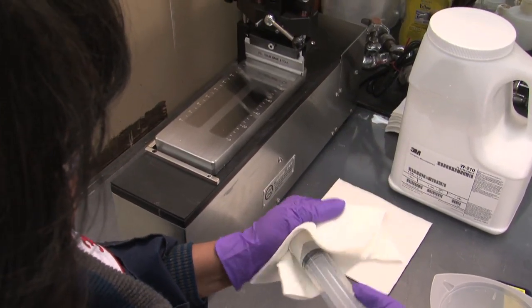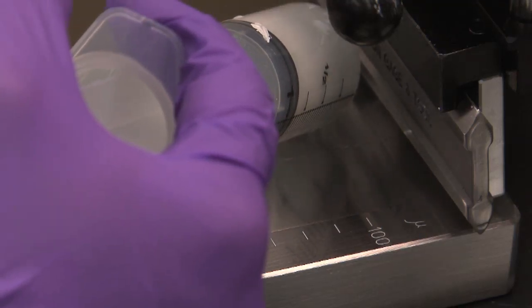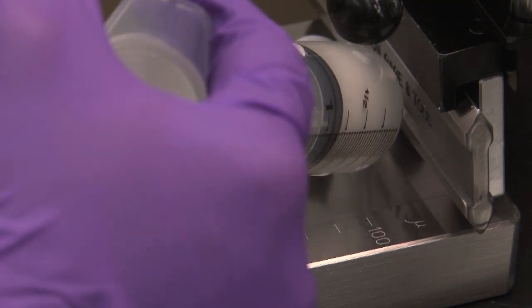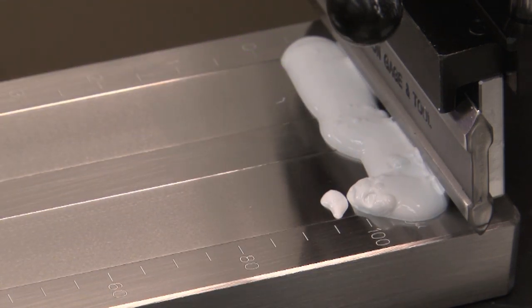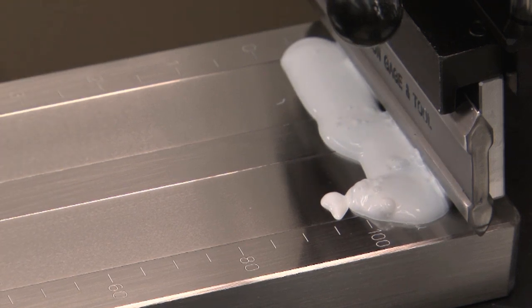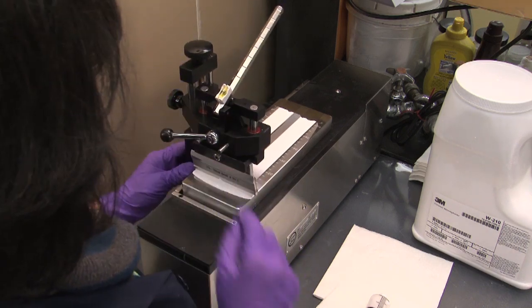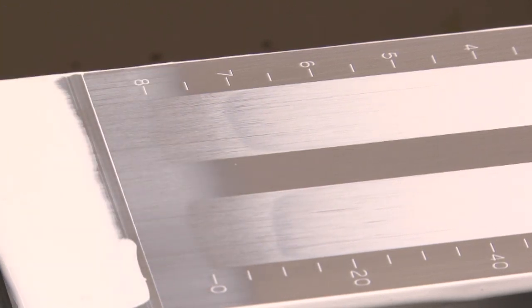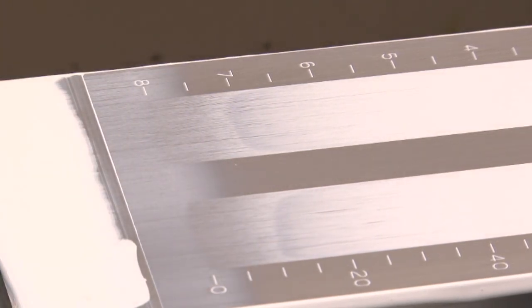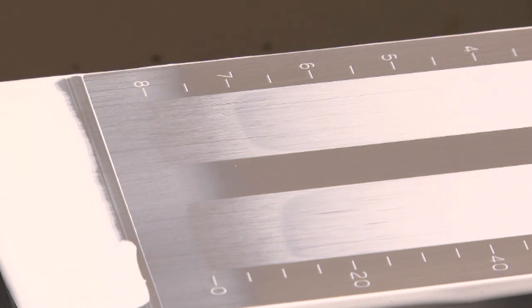A higher Hegman grind indicates a better degree of dispersion. This is a very desirable characteristic for architectural paints, as a high degree of dispersion will give a smooth texture while still maintaining the properties of a flat paint. We do the reading at the point where the uniform film ends and a distinct speckled pattern begins forming on the gauge. The results are valid for up to 10 seconds.